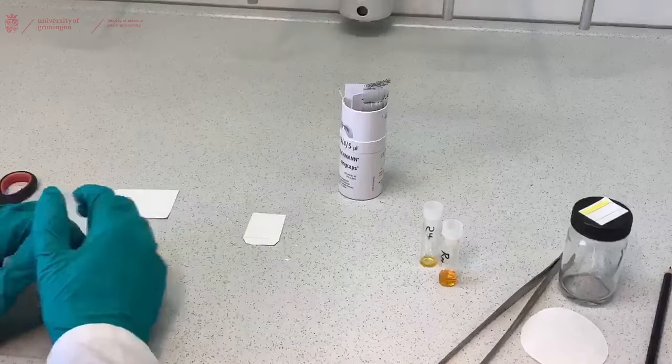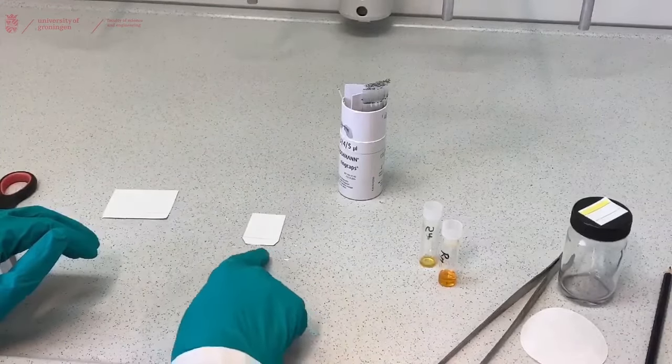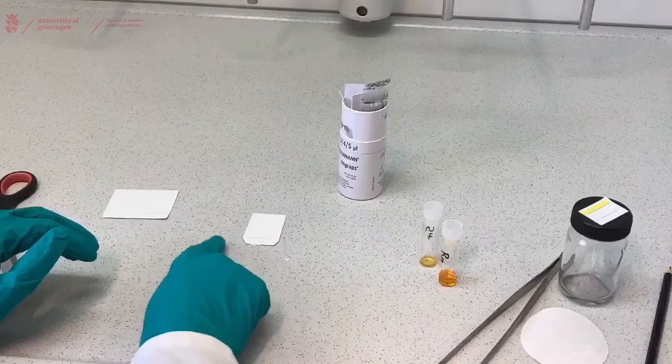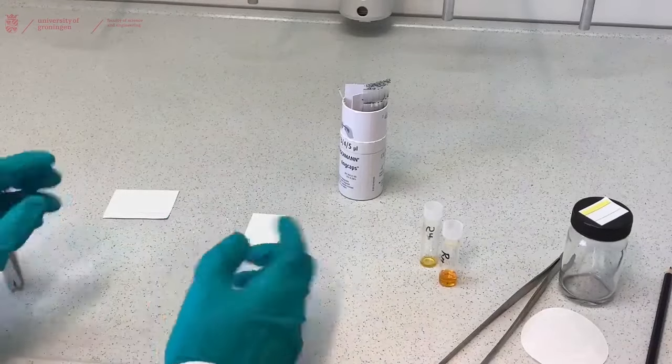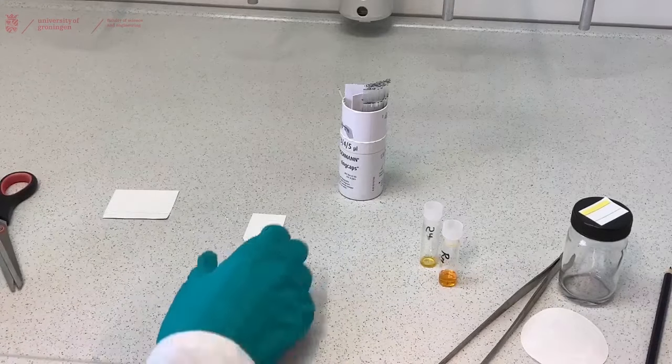When cutting your TLC plate make sure you do this in the fume hood and that you do it above a small box to collect the silica, because the silica moving around might cause some health issues.